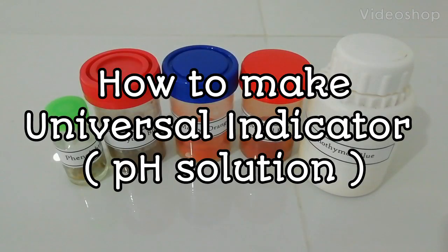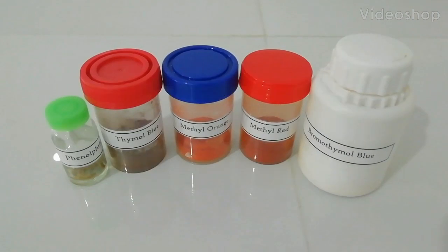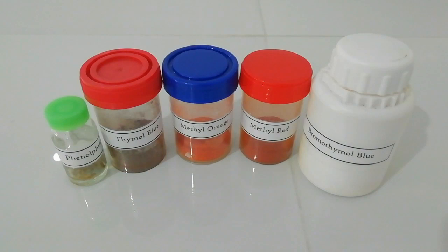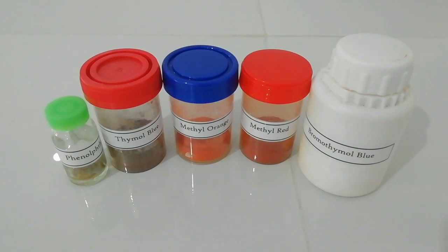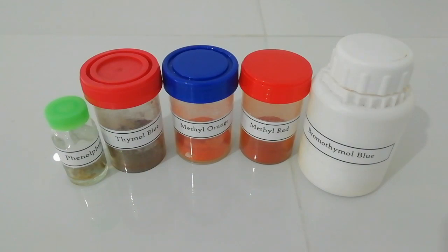This video shows how to make universal indicator, also known as pH solution. This recipe was found on the internet.